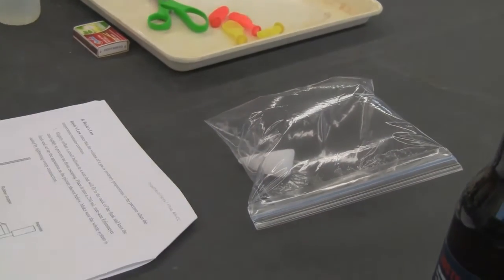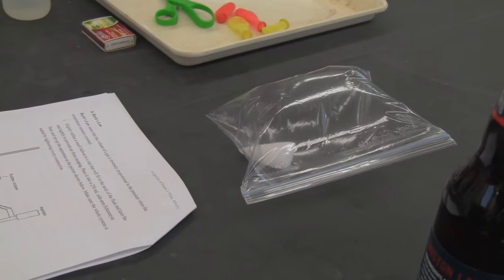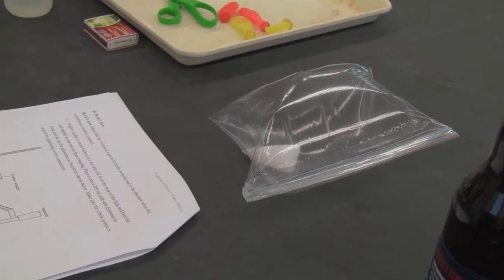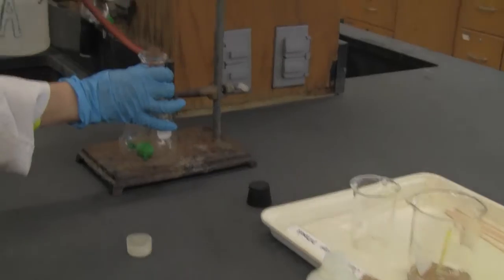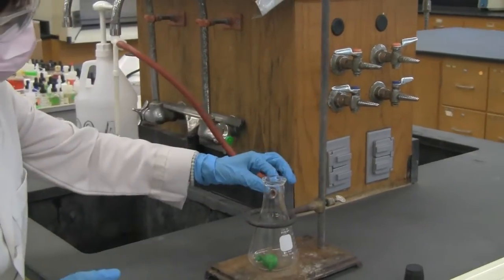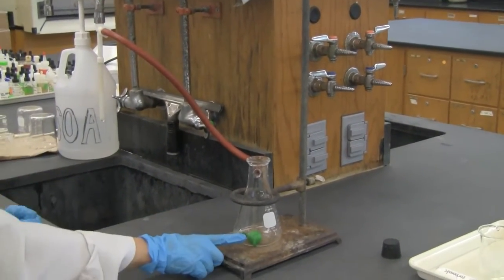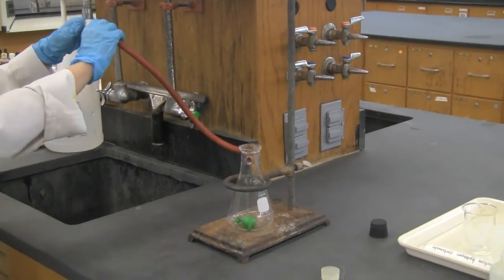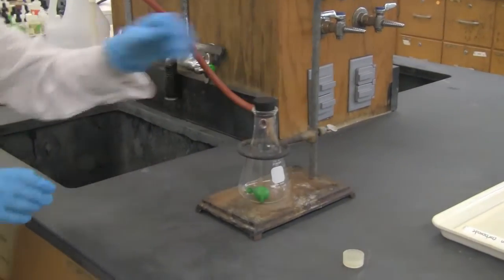Now let's move to part B, Boyle's law. Now you can see in step 1, we need to do some setup to change the pressure of the environment. So here is the setup. We have our container, a sidearm flask, and put the balloon in there. It's already blown up a little bit, so there's some gas in there. That's the gas we're studying. Here's the aspirator. We connect that and seal the whole system. Okay.